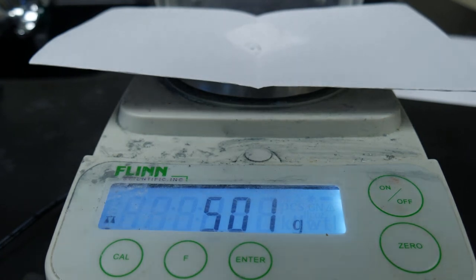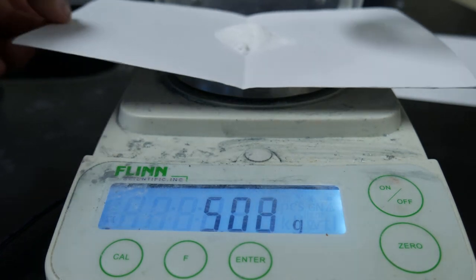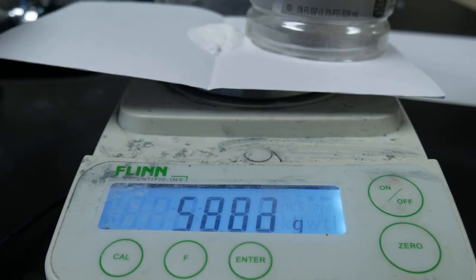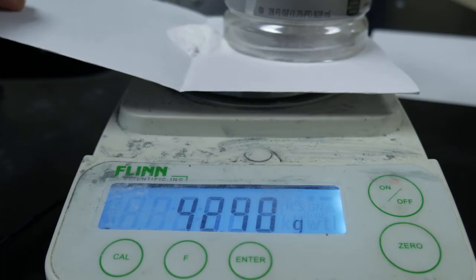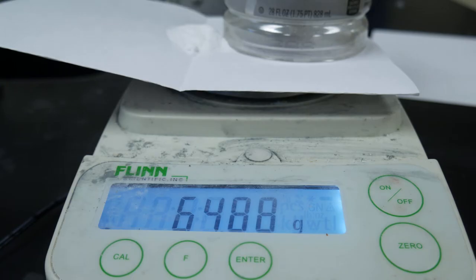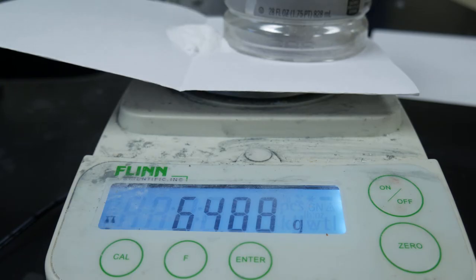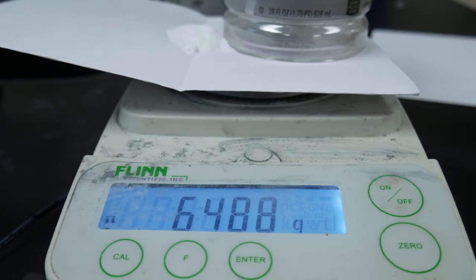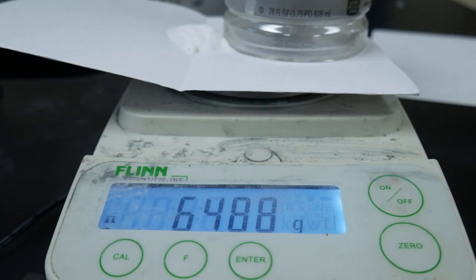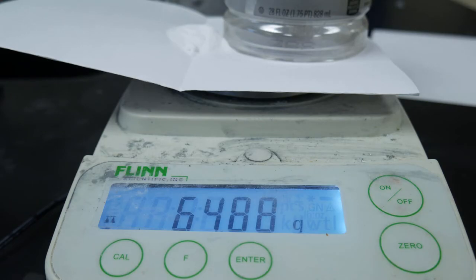Now we're going to add the bottle with the vinegar onto the scale with the baking soda and record the total mass of all the reactants before our reaction takes place. It looks like our total mass is 64.88 grams. Please record that in your data table as the initial mass of our reactants — 64.88 grams.